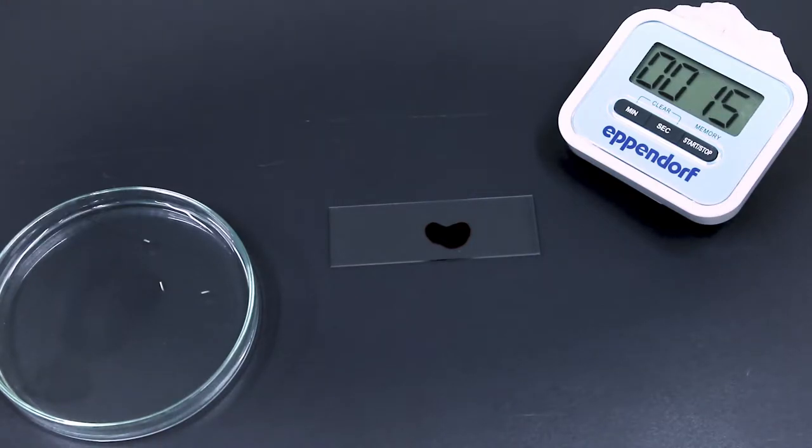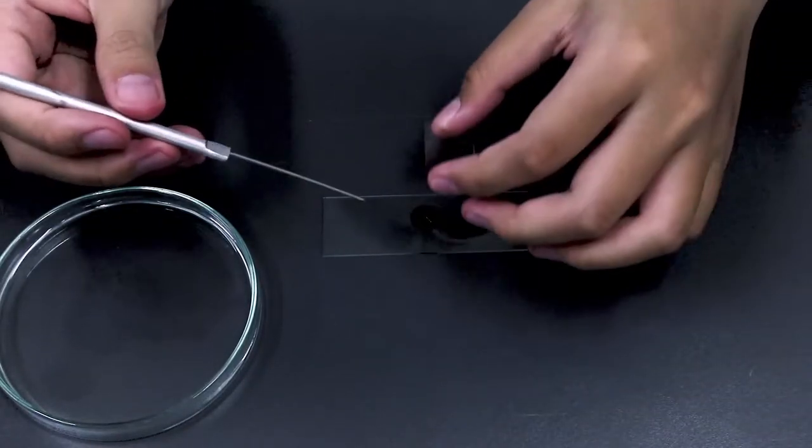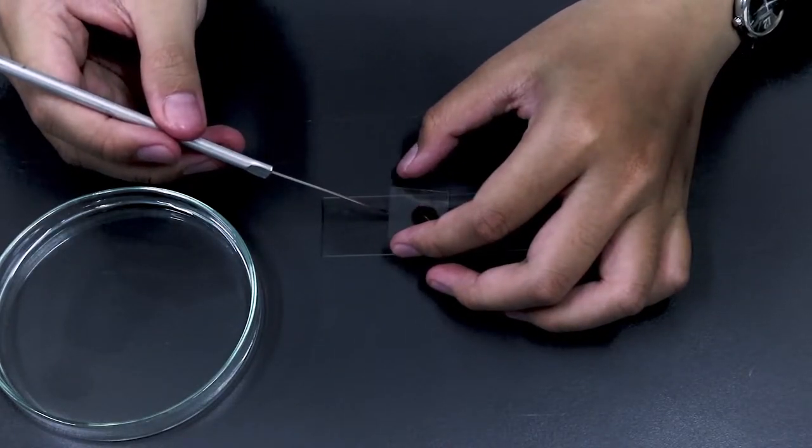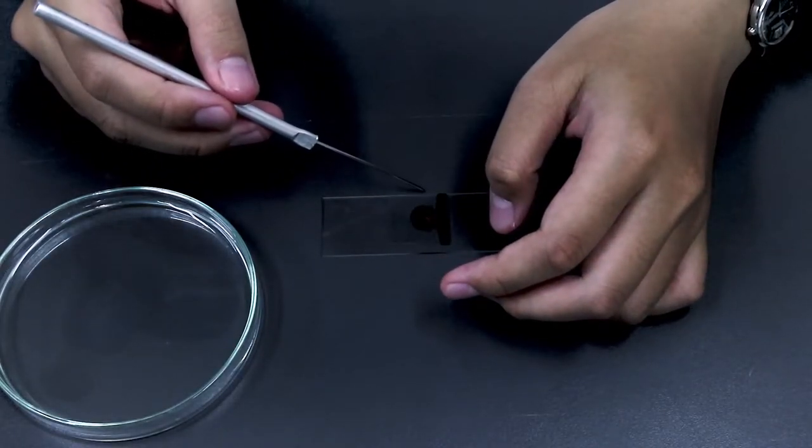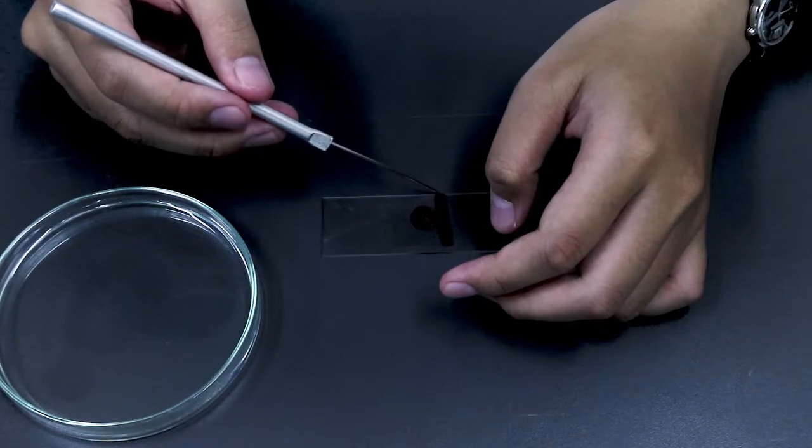During this time you can talk to your friend or do anything you want. At the end of five minutes you just use the cover slip to cover it on your slide.